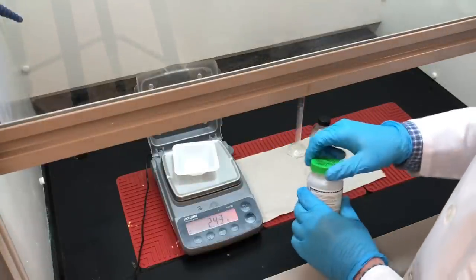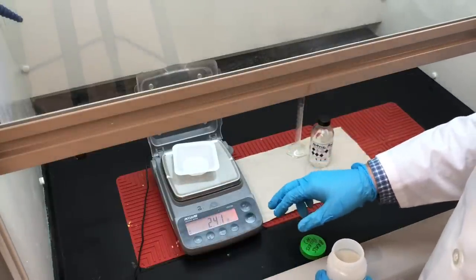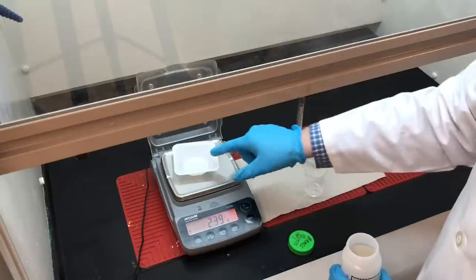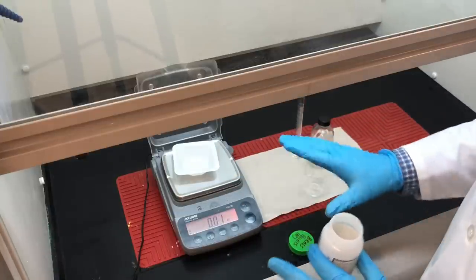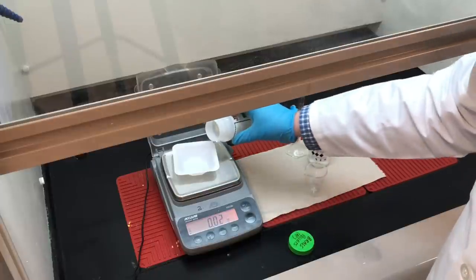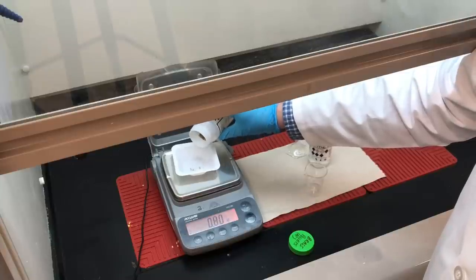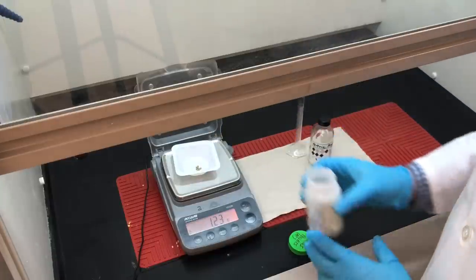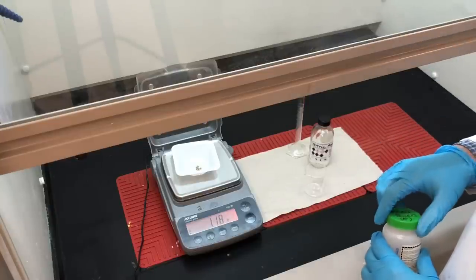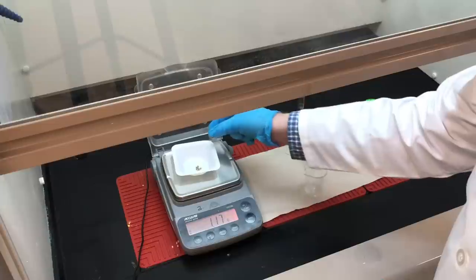Let's begin by measuring out the brass pellets. Brass pellets are an alloy of copper and zinc metal mixed together. I'm going to put a weighing boat on the balance and zero it, so the balance now ignores the mass of the weighing boat. I want somewhere between 1 and 1.5 grams of the brass pellets — it doesn't matter exactly what the mass is. Record that mass as the mass of the brass pellets.